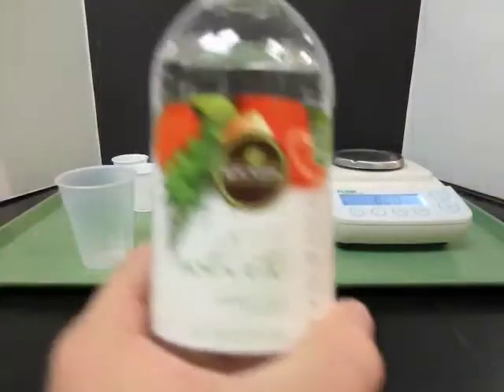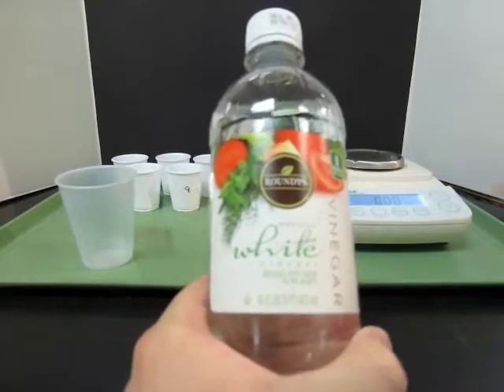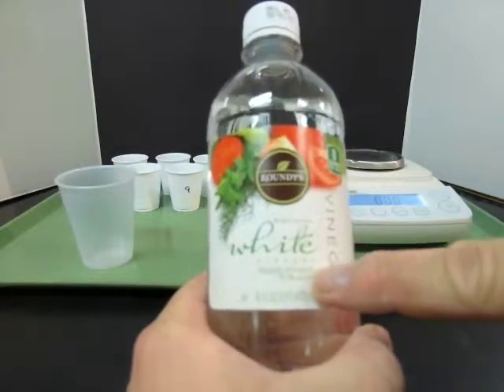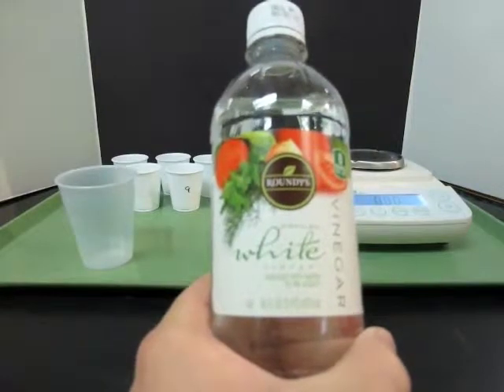Our goal today is to find out the acid concentration of white vinegar. It says on the bottle that it's 5% acidity. We're going to compare our results to that value to see how accurate and how precise this particular analytical technique is.